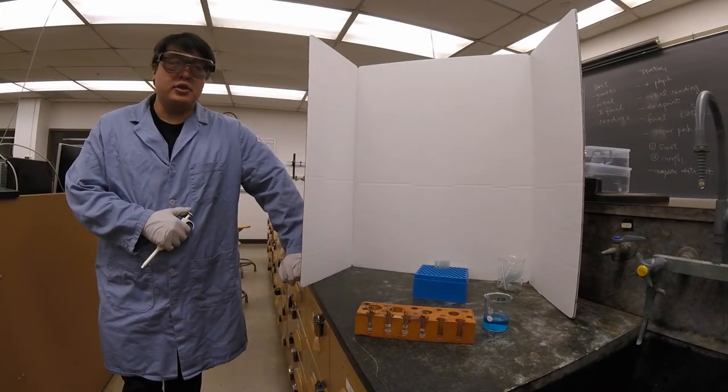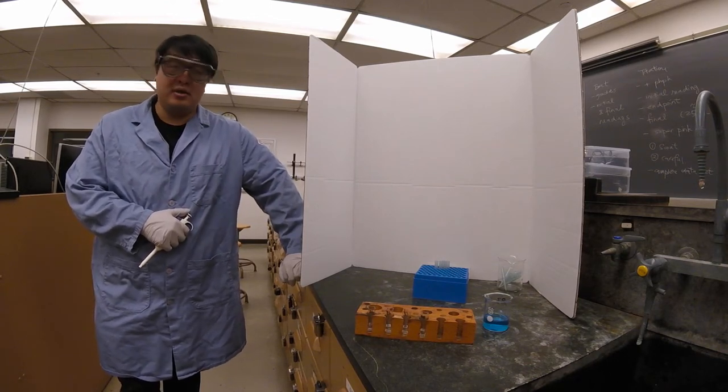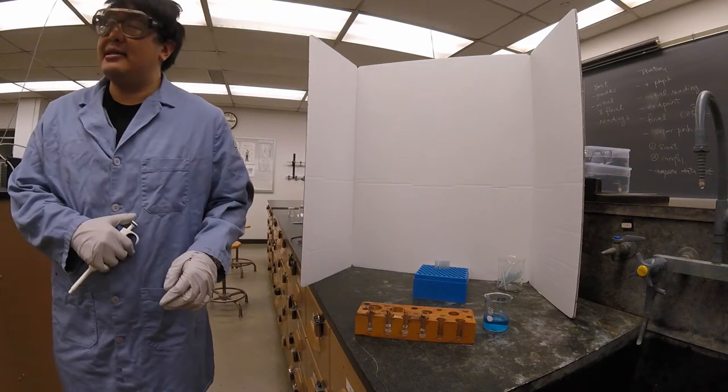This is the video to do the micropipetting for samples B1 through B4. This will be a commentary-less demonstration.